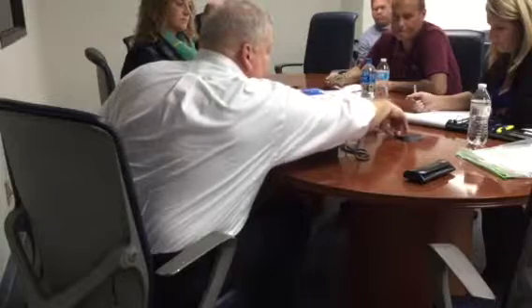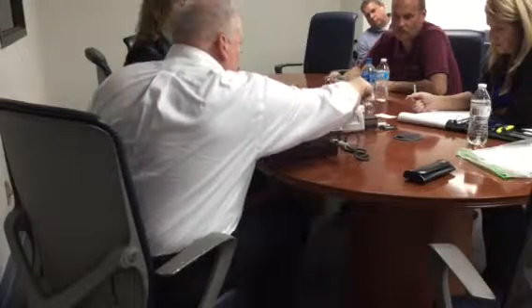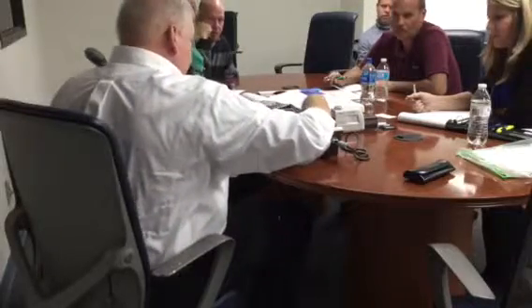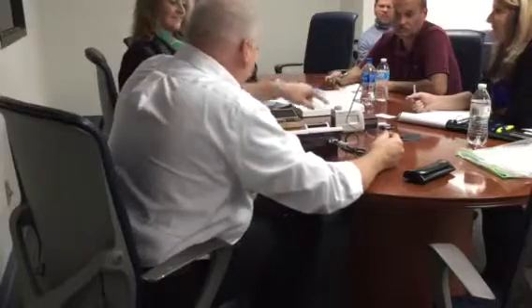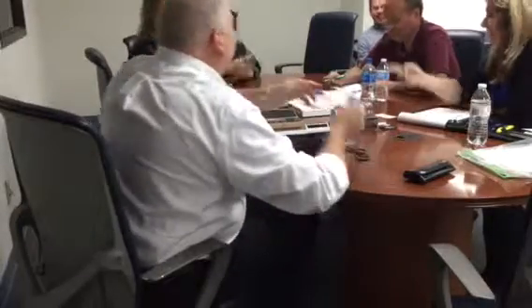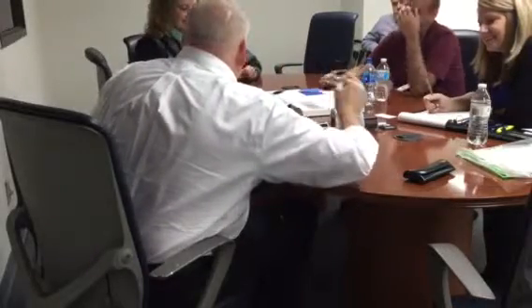This is what they call the stylus. This is the detector. This is the drive unit. This is called the leveling shroud, and this is called the controller. Okay. It'll be a test when I'm done. What I want to do is establish repeatability with the stylus, because repeatability tells me the unit's working properly.